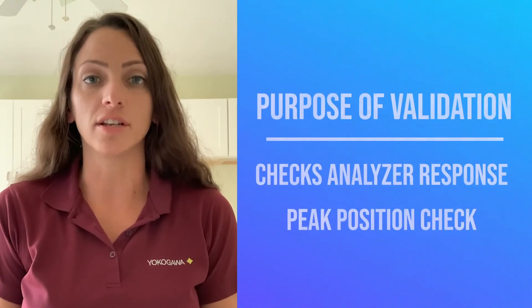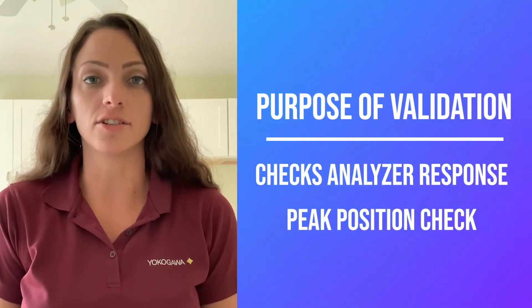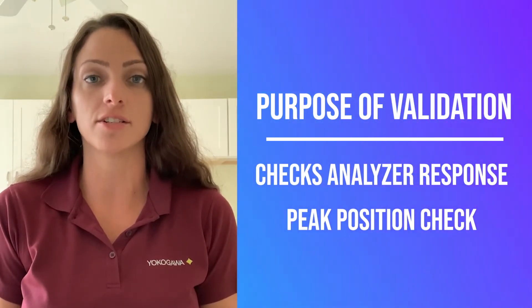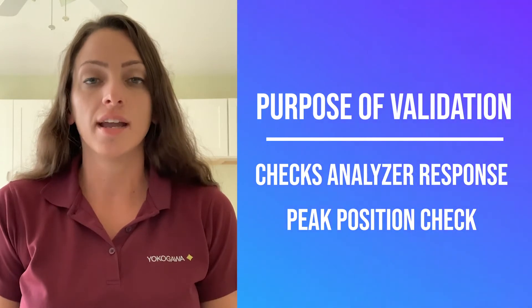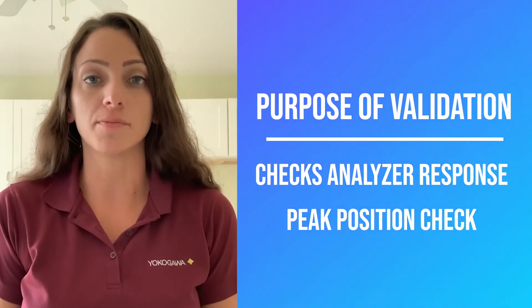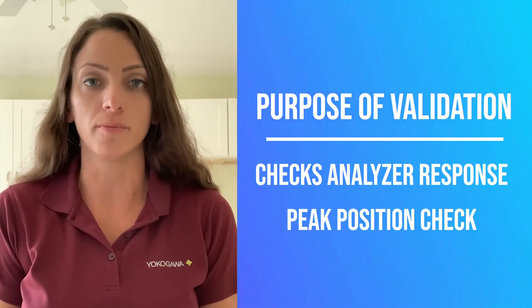The purpose of validation is to make sure the analyzer is responding when the measured gas is introduced and to make sure that the peak is positioned correctly for accurate measurement.